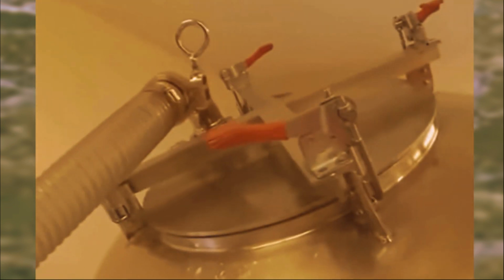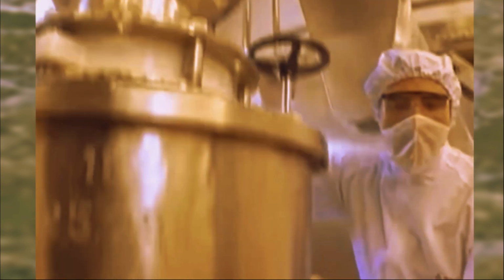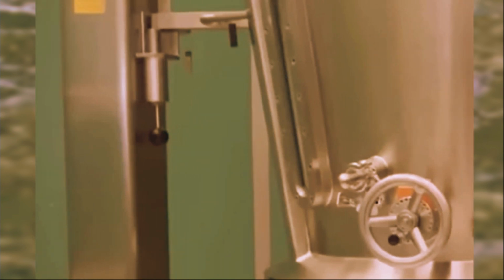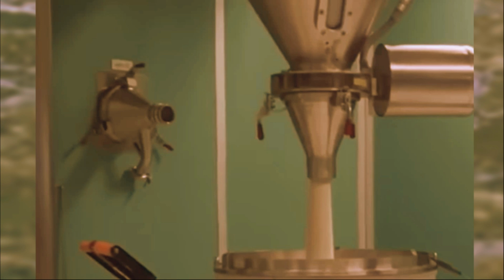We use a special solvent like water or ethanol to dissolve everything. Then we crank up the heat a little, helping all that gunk separate from the good stuff. As the solution cools down, magic happens. Pure aspirin crystals start to form, leaving the impurities behind in the solution. This purification process is crucial. It ensures that the final aspirin we get is pure, safe, and effective for relieving those aches and pains.